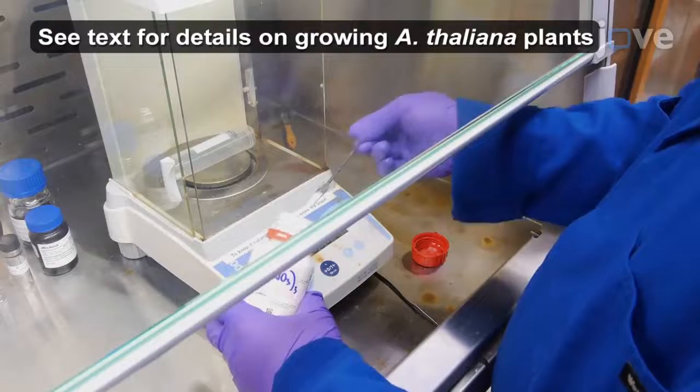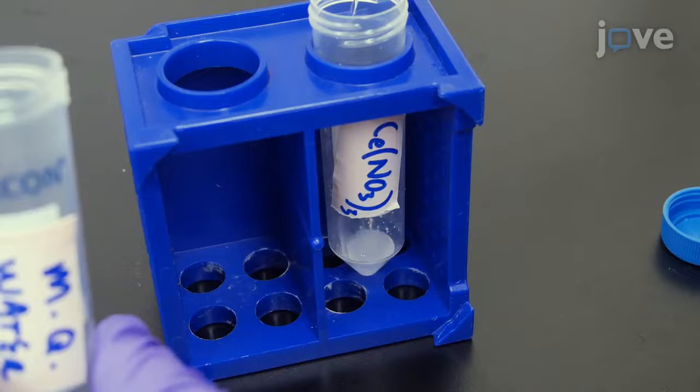After growing the Arabidopsis thaliana plants, weigh out 1.08 grams of cerium-3 nitrate and dissolve it in 2.5 milliliters of biology-grade water in a 50-milliliter conical tube.